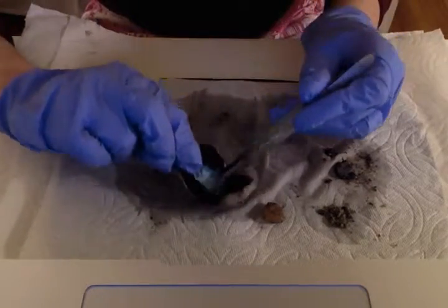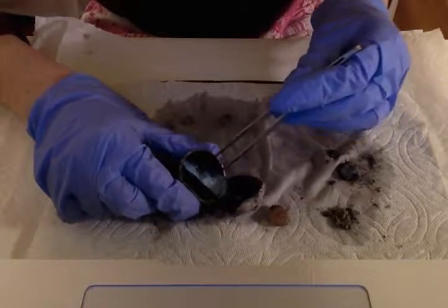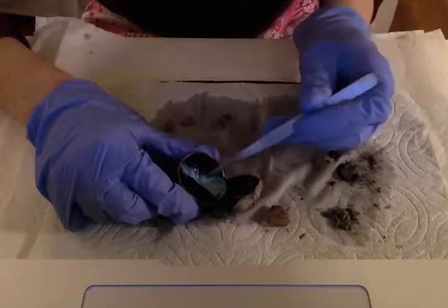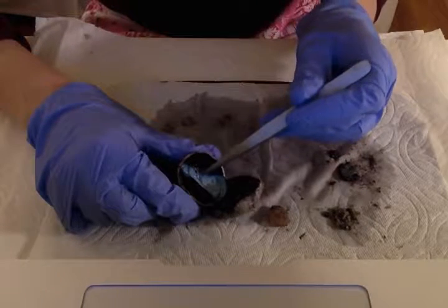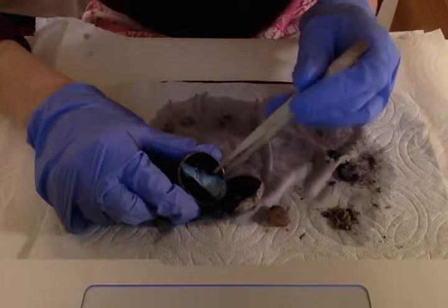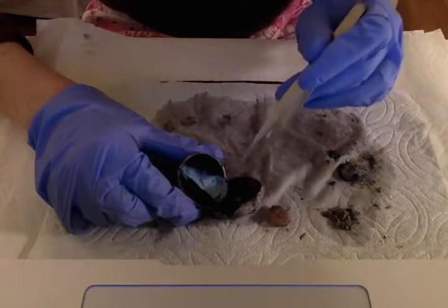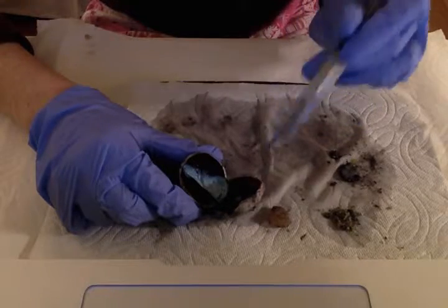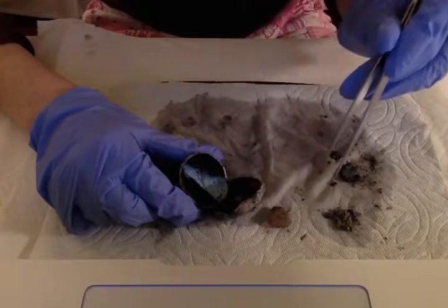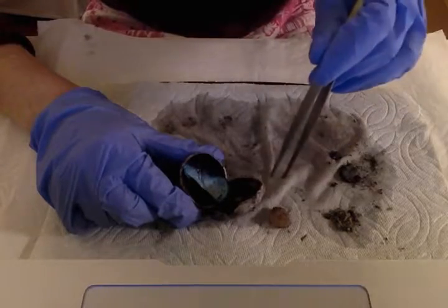I'm not sure how perfectly you'll be able to see this on video, but right here, there's this little hole or kind of circle, and this is the optic disc. Now, the optic disc is the place where the optic nerve and arteries and veins enter or exit the eye. There's no photoreceptors on the optic disc, so it basically creates an area of the eye where light's not perceived. So the optic disc is commonly referred to as the blind spot.